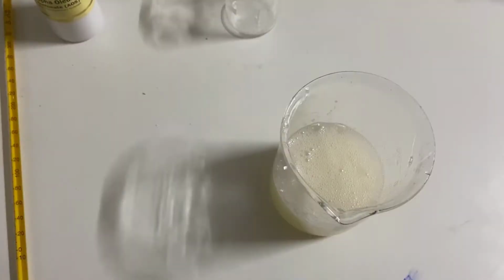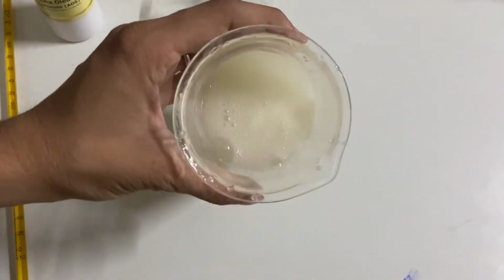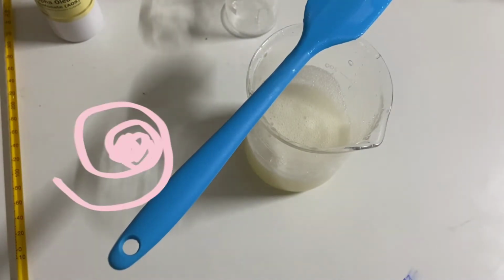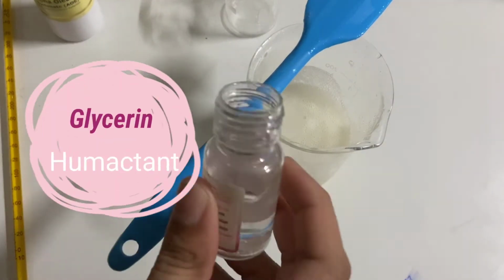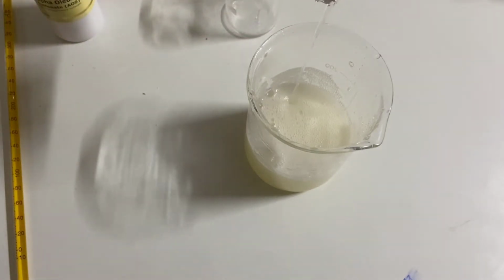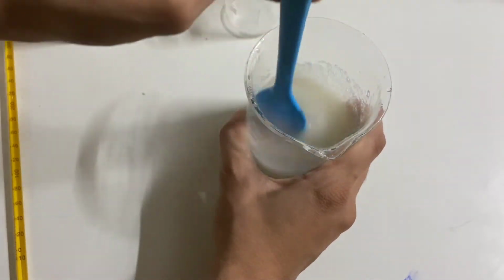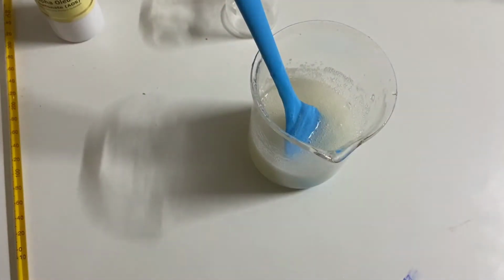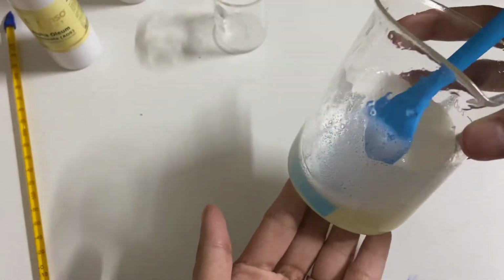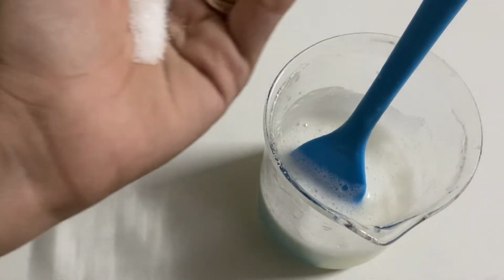After this, we need to cool it down to room temperature. When it reaches room temperature, we have to add glycerin into it. Glycerin is a humectant for us. It will give a nice moisturizing property to our hands. Because of continuous stirring, you can see foam is incorporated inside it. For that, I am keeping it aside for 10 to 15 minutes. Now you can see the clear liquid inside the beaker from the downside. At this stage, it is completely at room temperature.